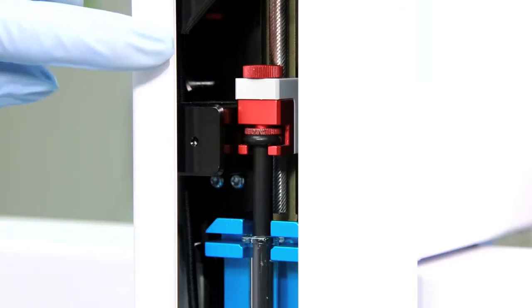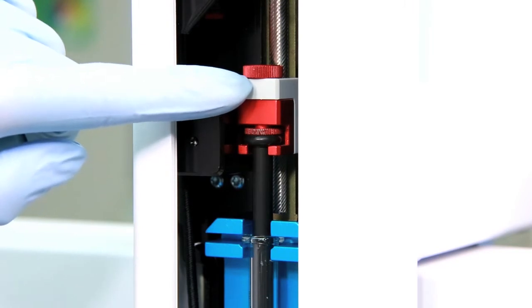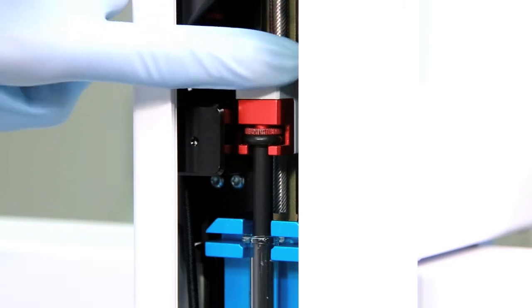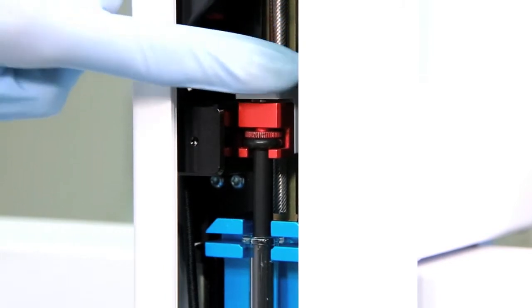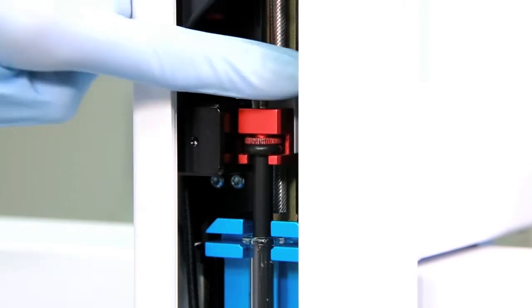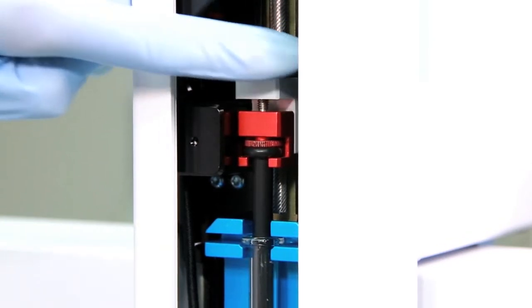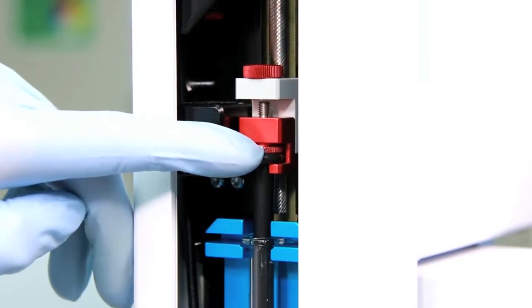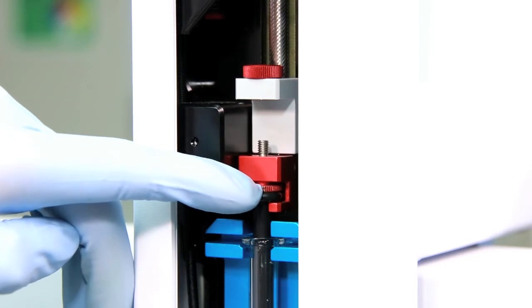To remove the syringe you first have to loosen the upper red retaining nut. Loosen it completely. You can see the plunger is moving down. When the nut is fully loosened you then move the syringe plunger all the way down.